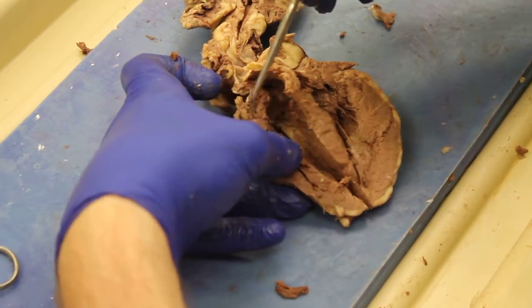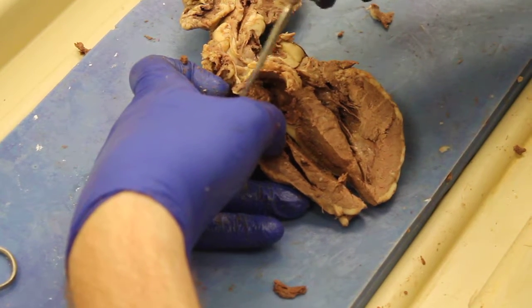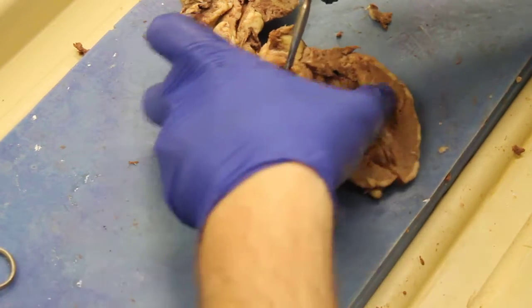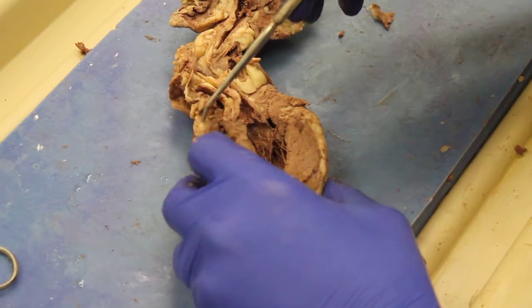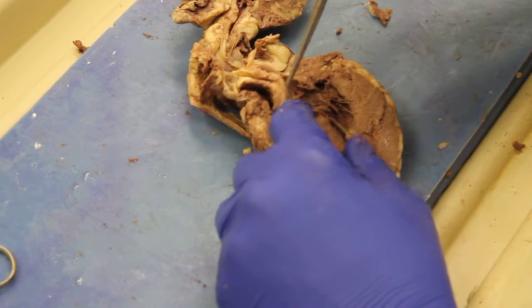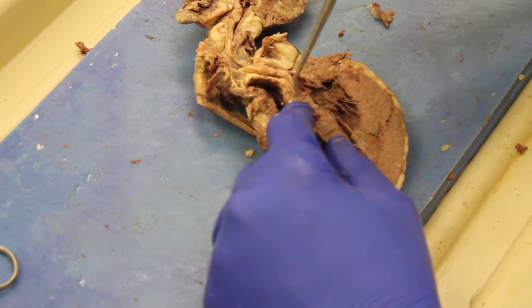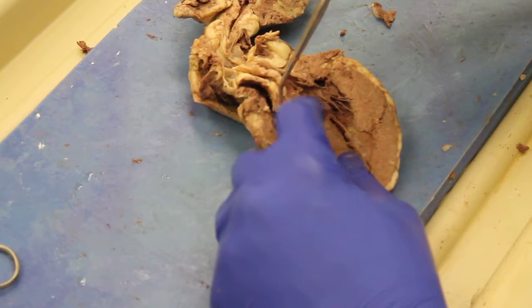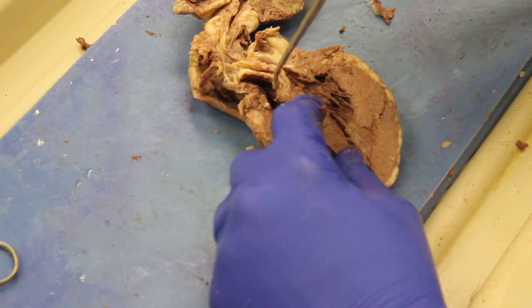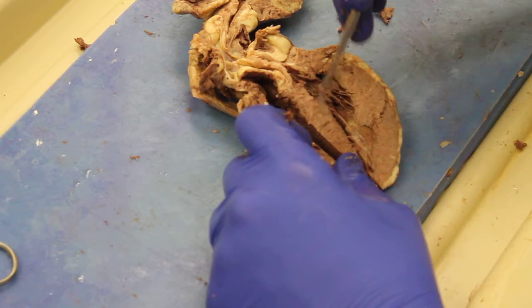node. Our atrioventricular ring is going to be along this line, preventing the transfer of that wave of excitation through that atrioventricular ring into the ventricular region.